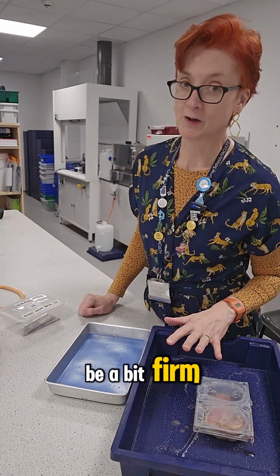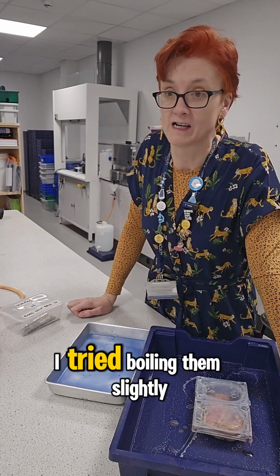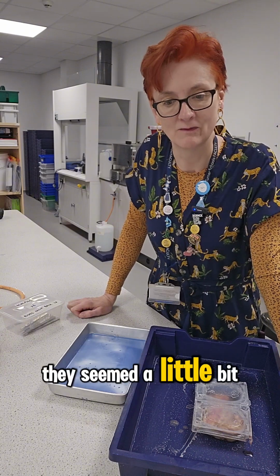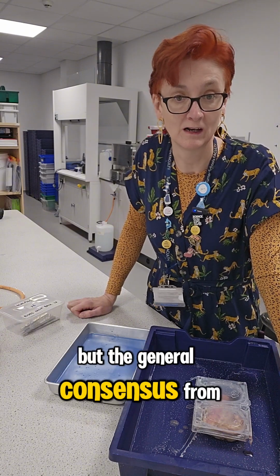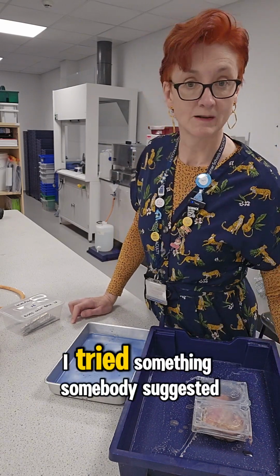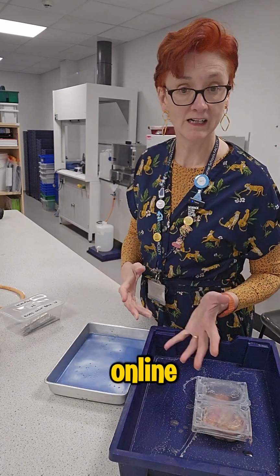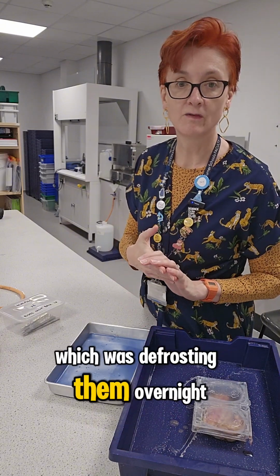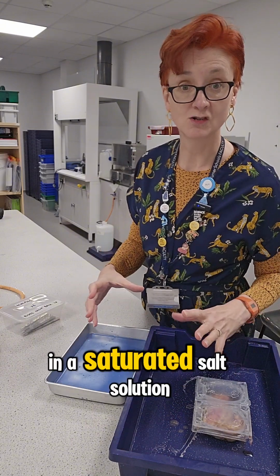So you want them to be a bit firm. First time I did the practical, I tried boiling them slightly. It seemed a little bit firm, but the general consensus from the class was mush. Second time we did the practical, I tried something somebody suggested online, maybe it was even you, which was defrosting them overnight in the fridge in a saturated salt solution.